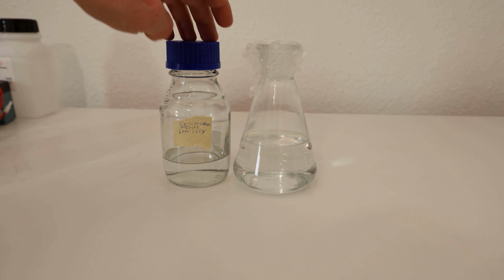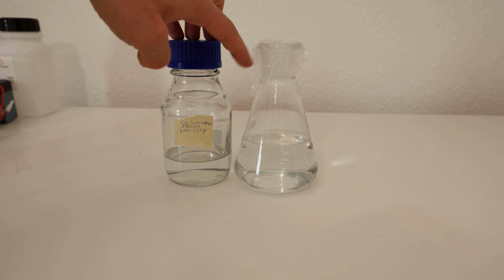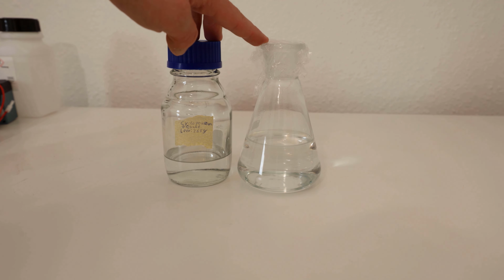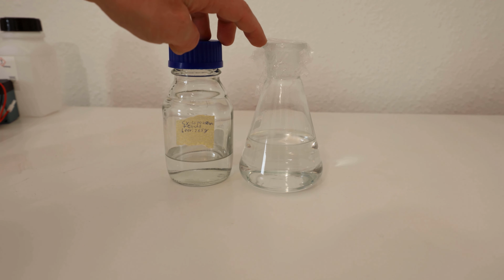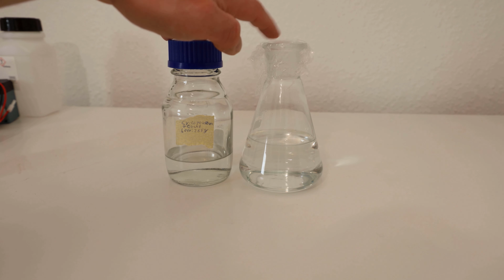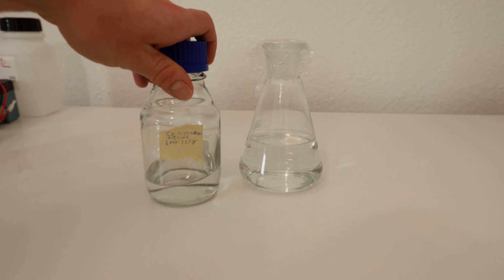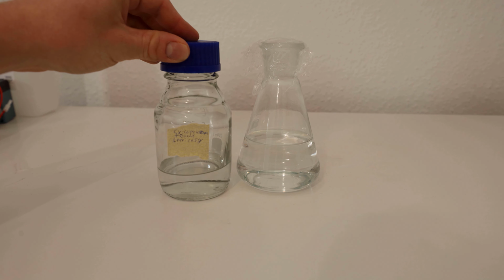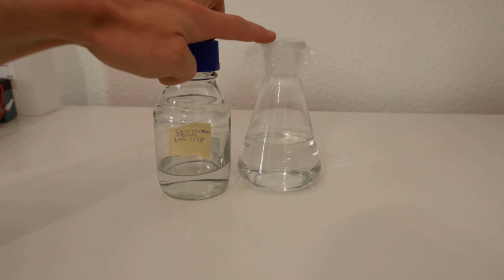This is a yield of 59.3%. Pretty okay. It's not a lot, so I think I will get some more adipic acid and do another batch of this at some point. But for now I will just continue with this, because for the next reaction I definitely want to check out how well it works and not go in with a complete batch here.